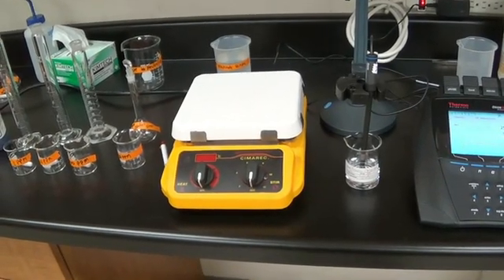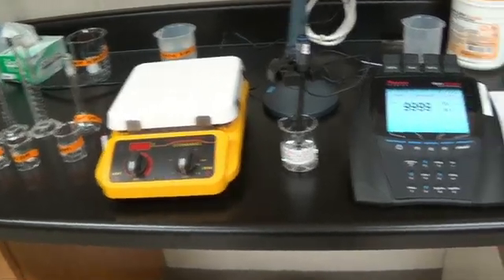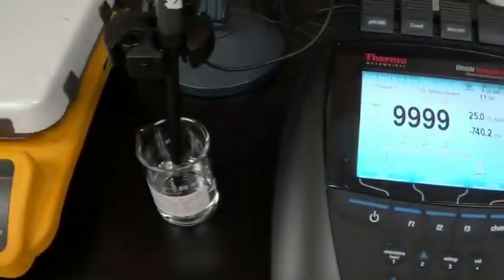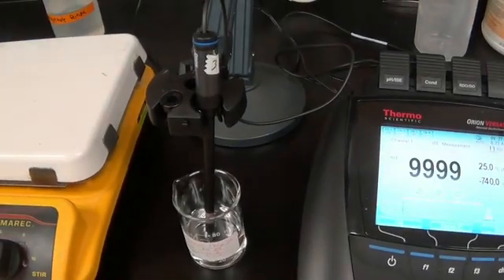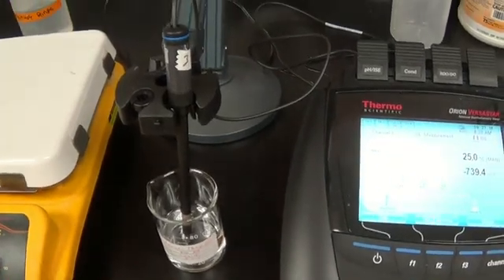This is a demonstration on our ammonia lab that we are going to do today. So we have our pH meter set up. We are going to use a probe for ammonia. The first thing that we do is we have to prepare the probe.